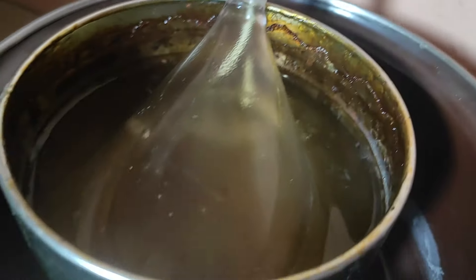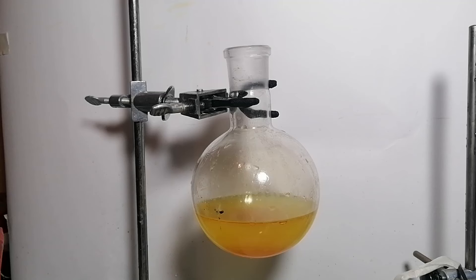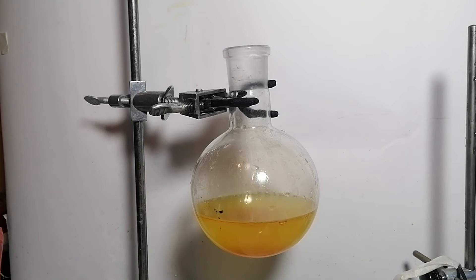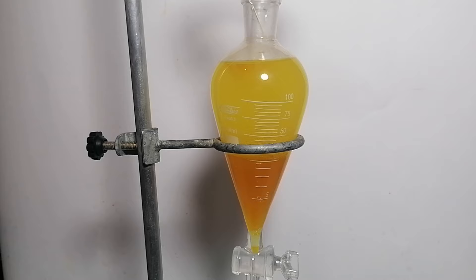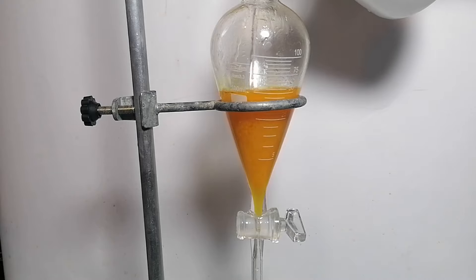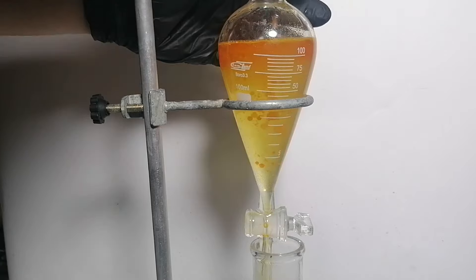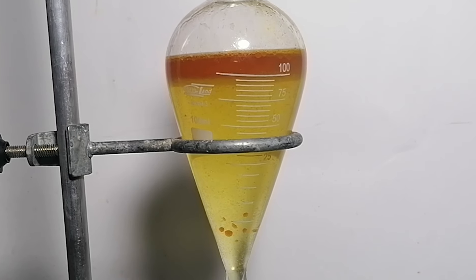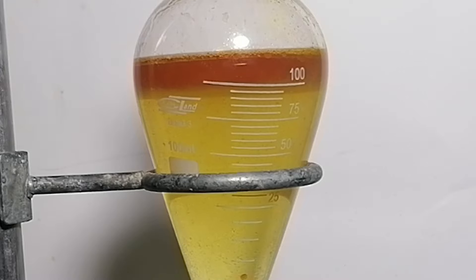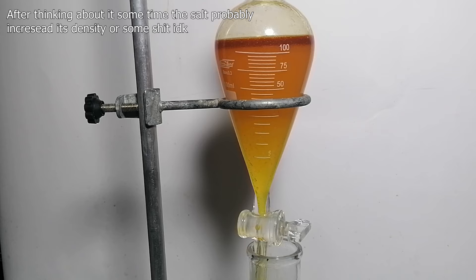Either way, something is happening and we are producing benzaldehyde. The whole reflux was run for like two hours, during which I played some Minecraft. Okay, here's the boiling flask — now let's separate out the organic layer. For some reason the organic layer starts out at the bottom. I threw away the water layer and then did the sodium carbonate washing and later sodium chloride washing. For some reason during the sodium chloride washing the whole thing went to the top — I honestly have no idea why, but perhaps it has something to do with the sodium chloride taking out all the water from the organic layer, which I guess makes it less dense?